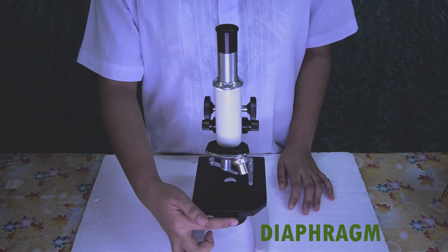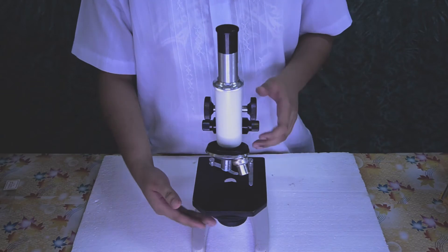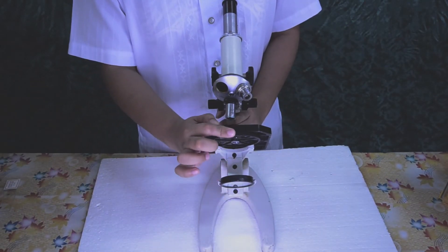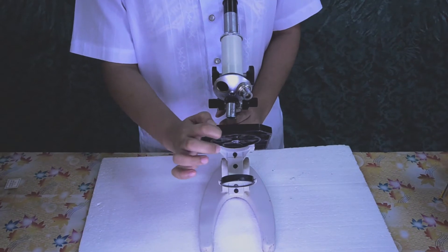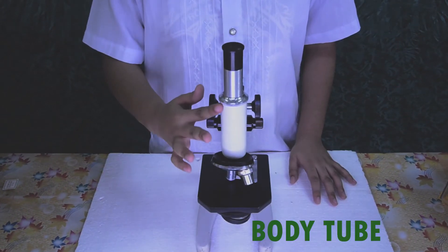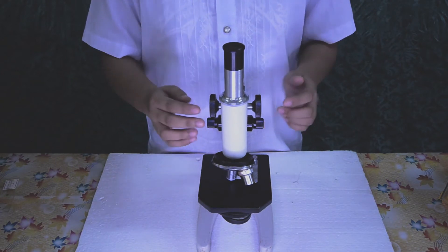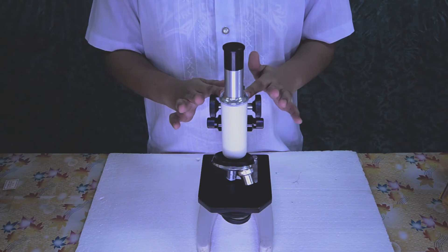Diaphragm. It is attached beneath the stage. It regulates the intensity or amount of light entering the microscope. Body tube. It is the tubular hollow part attached to the upper part of the arm of the microscope.